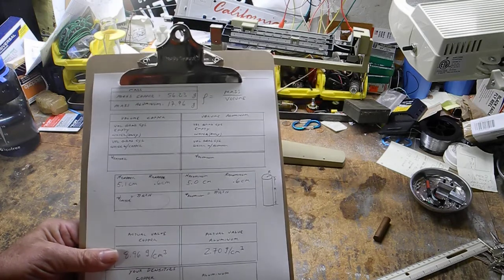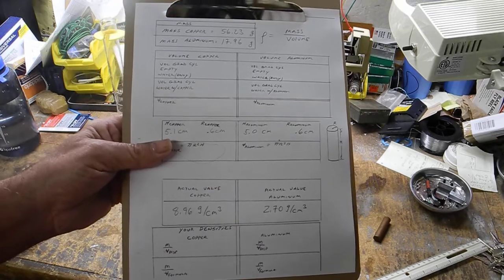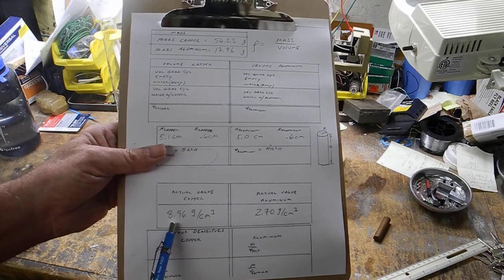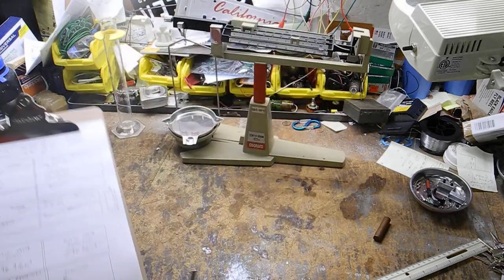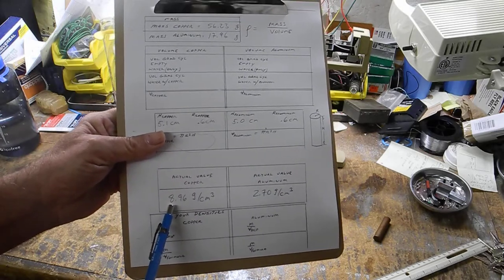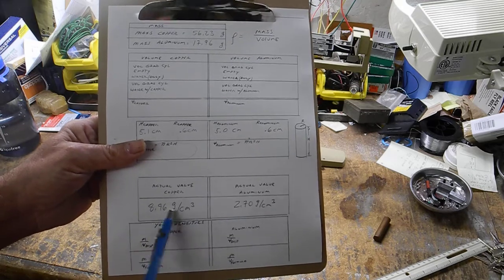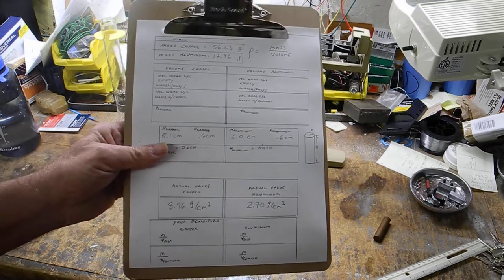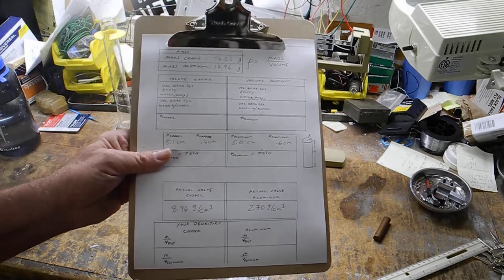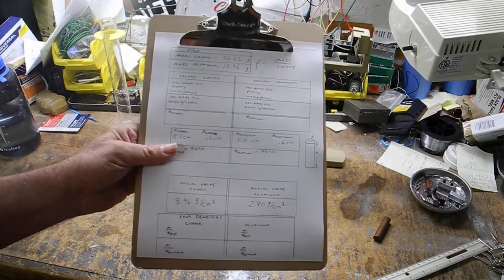And then we do water displacement. You'll have some other densities. By the way, the actual value for density, and you need this for answering the questions that are posted elsewhere, is if you do this super precise, with a much better balance and a much better way of measuring volume, the actual density of copper is 8.96 grams per cubic centimeter, and aluminum is 2.70 grams per cubic centimeter. So if your answers aren't in that ballpark, maybe you did some calculation wrong, or I did something wrong. But I've done this lab before many times for years, and my numbers seem okay here so far.